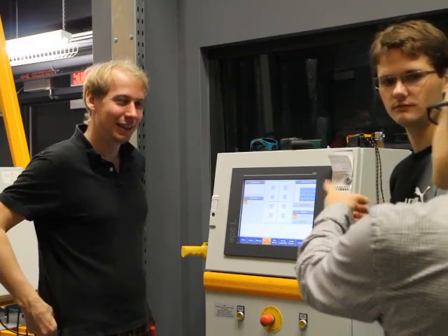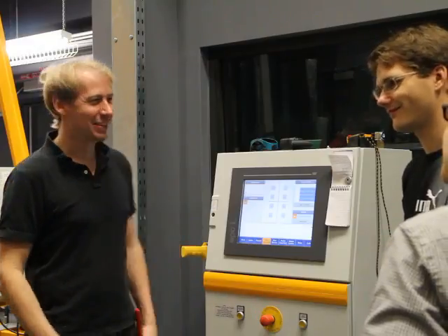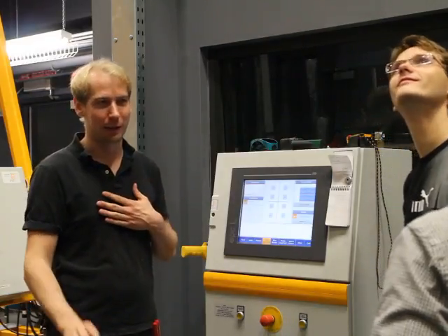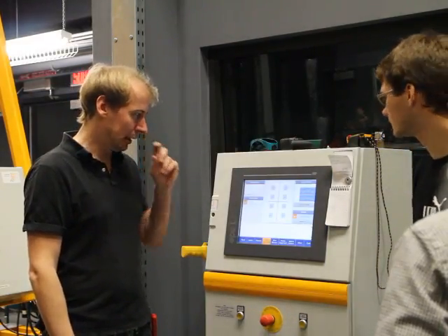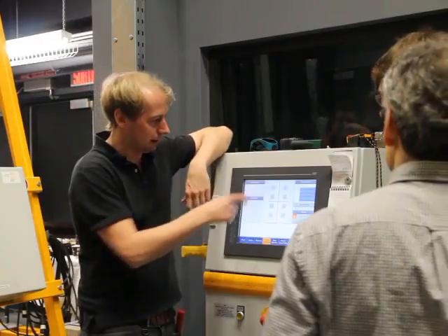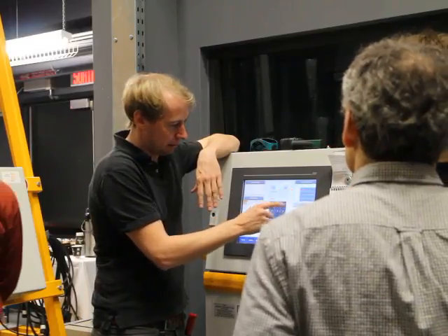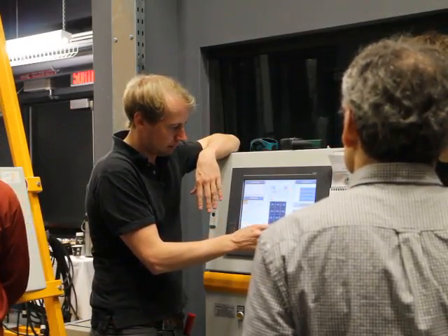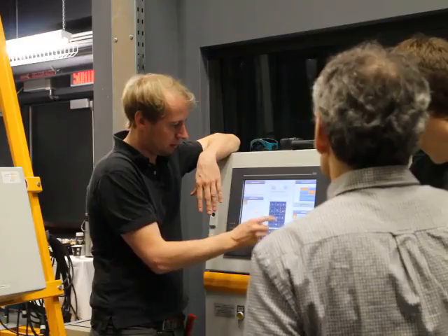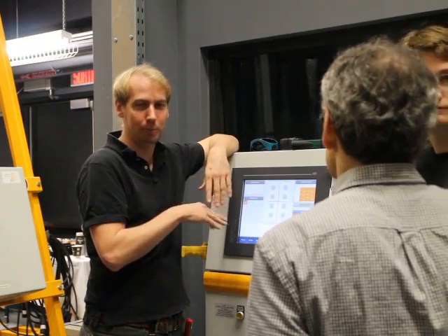You want to give this some time, right? No, I'm just talking. It will heat up again, because when we switch on the lamps, the configuration will be a different one. For setting the lamps, we see that they are off at the moment. Switching on the lamps is the same. We can either do one, or you can set all, whatever you want. We're playing around with the homogeneity.